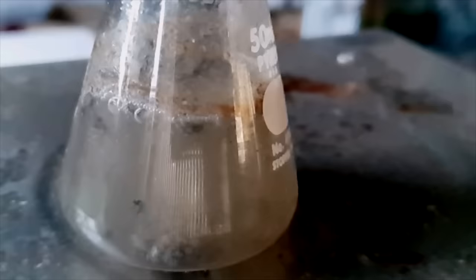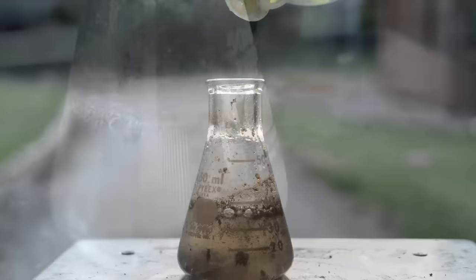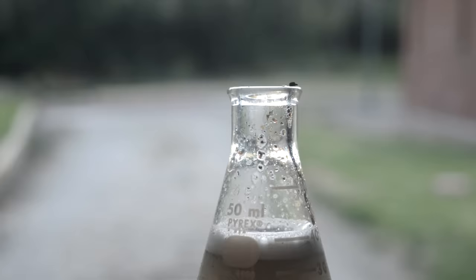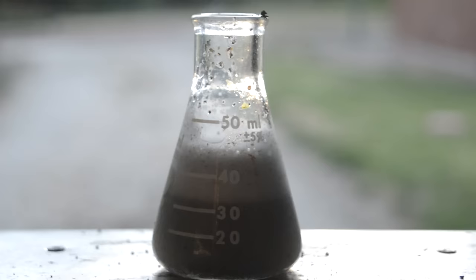How do we make this demo more dramatic? Let's grab some soap, because what we want to do is generate some bubbles. Straight away we know it's not going to work terribly well because we're adding soap to an acid solution, so it's not really going to foam terribly well, but it still does work to an extent.